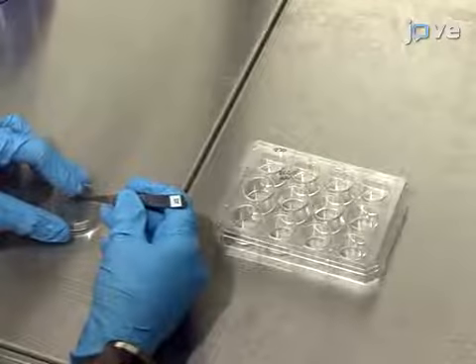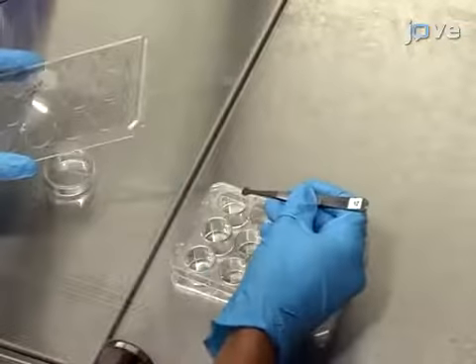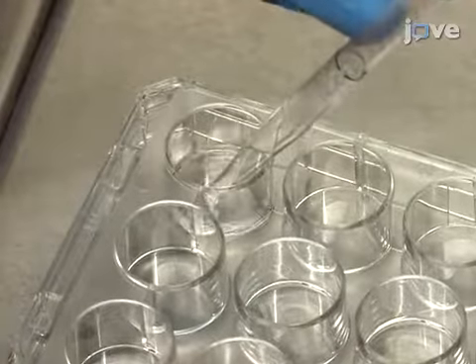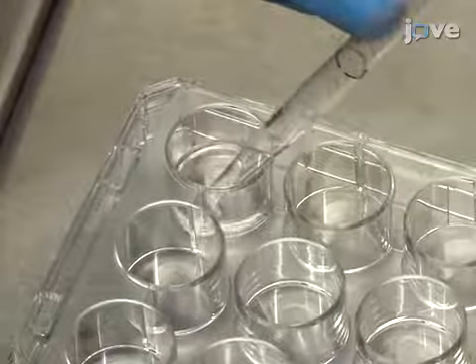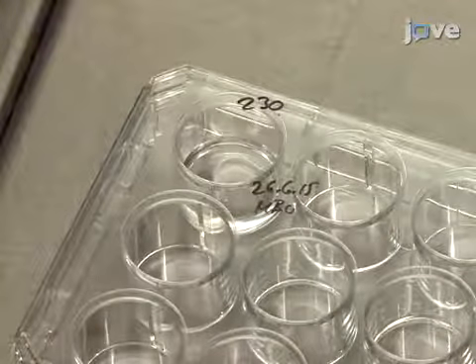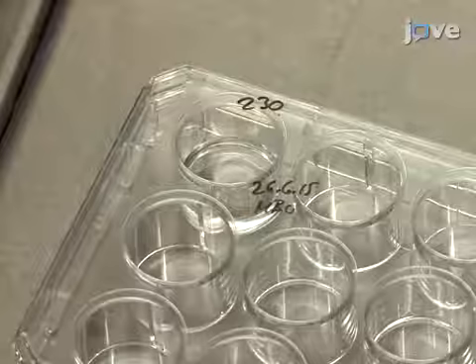Begin by placing the glass substrate so that the micropost array faces up into the well of a 12-well plate. Indirectly add 1 milliliter of 99% ethanol to the well so that the substrate is covered. Make sure that there is no bubble formation during any liquid handling steps and that the micropost array is always covered by a thin layer of liquid.